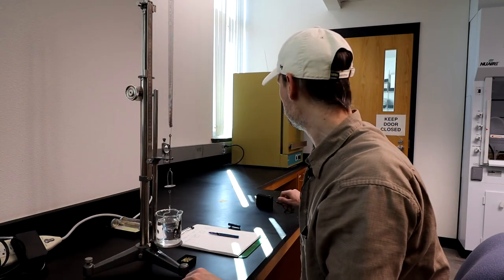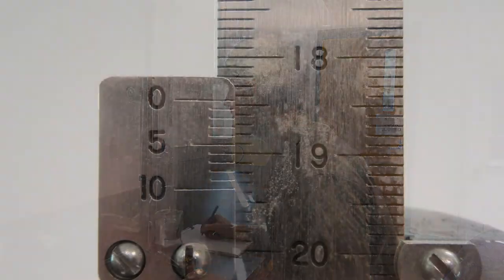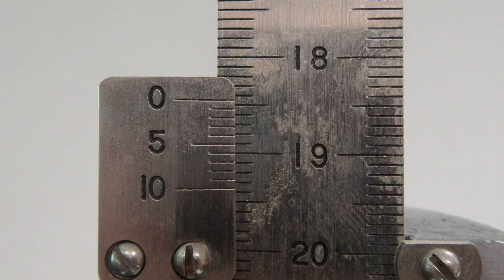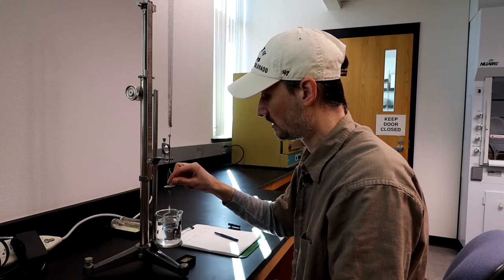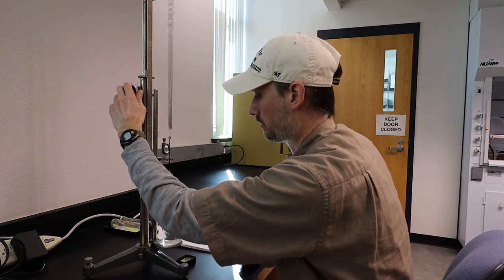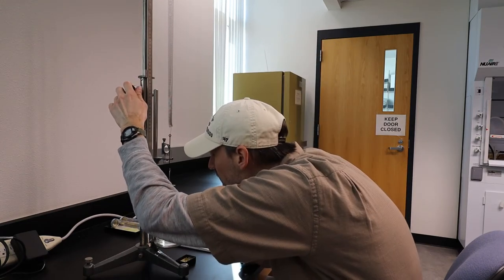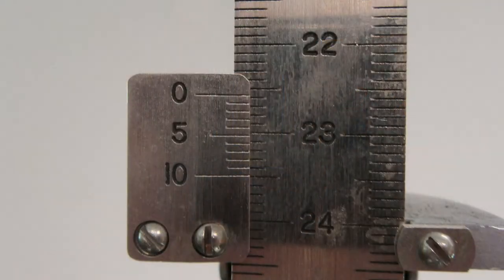I level it, read it off: 18.45. Take the next specimen, put it in the upper cup, level it, read it off: 22.59.